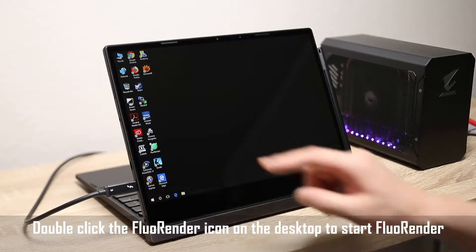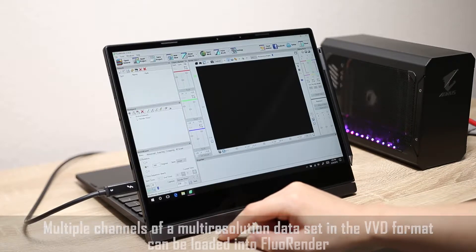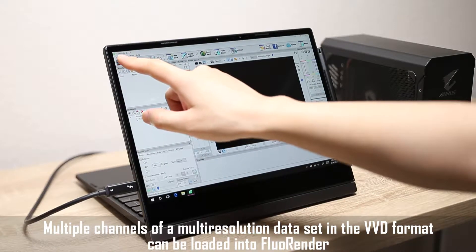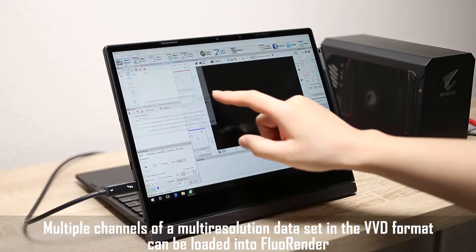Double-click the FluoRender icon on the desktop to start FluoRender. Multiple channels of a multi-resolution data set in the VVD format can be loaded into FluoRender.